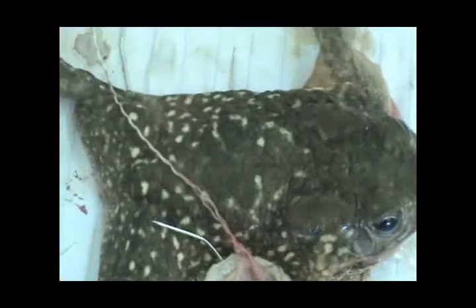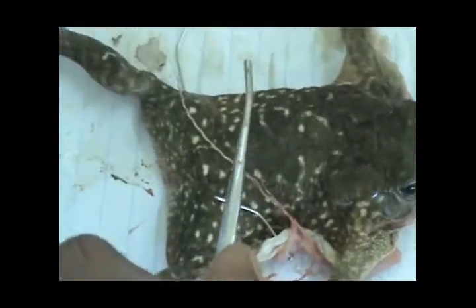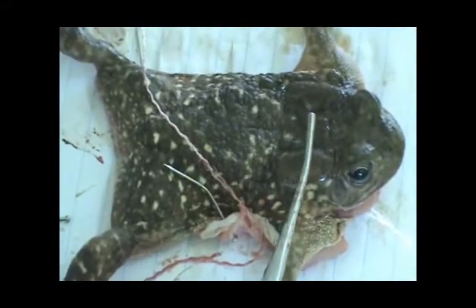These are the two major poison glands, which are mainly for defense. In terms of danger, they can produce and secrete poison in order to defend themselves. The frog also has a thin skin with a large surface area, and since its gaseous exchange takes place across the skin, it's not like us who have only lungs. It has long hind limbs — the hind limbs are longer than the forelimbs — for facilitating forward propulsion so that it can easily jump.